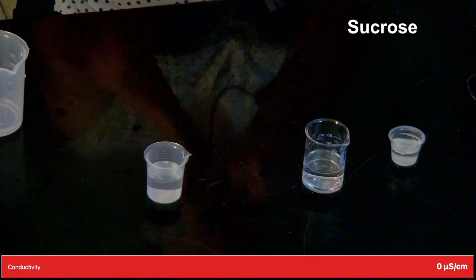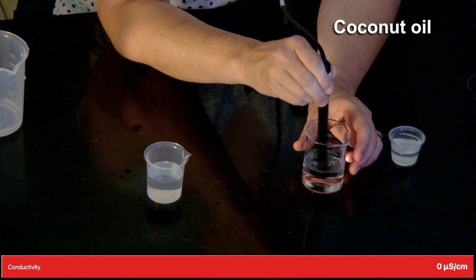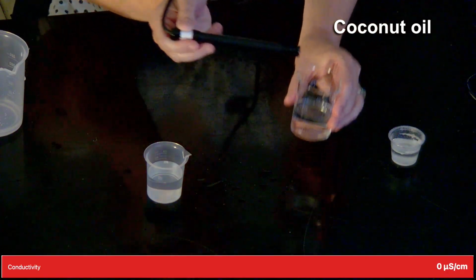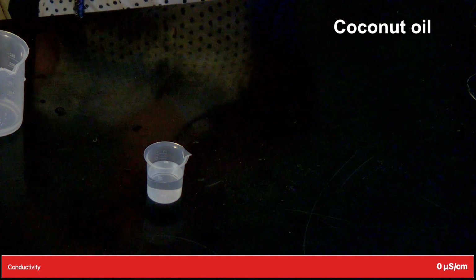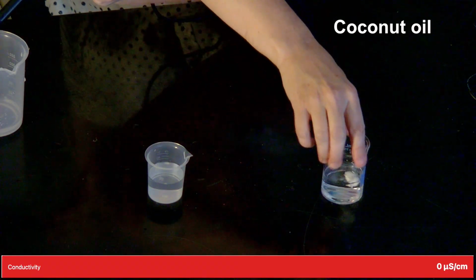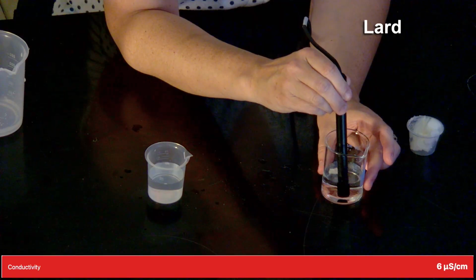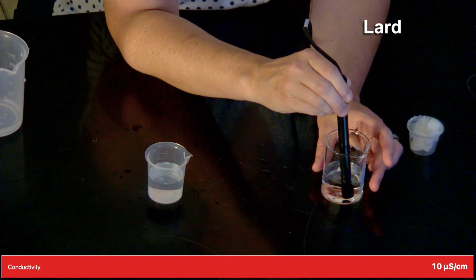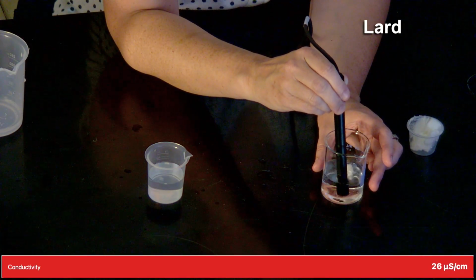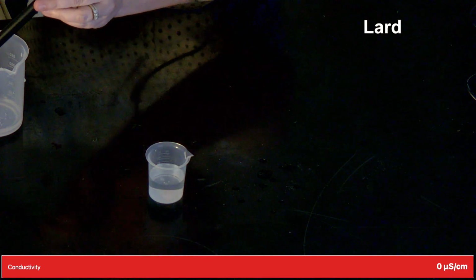Next we have coconut oil. And lard. Then we have cornstarch.